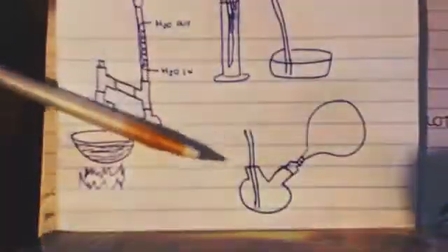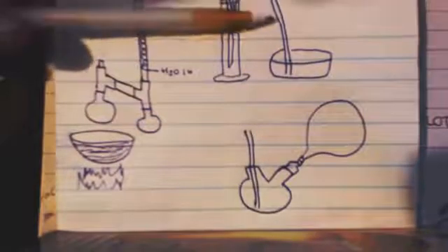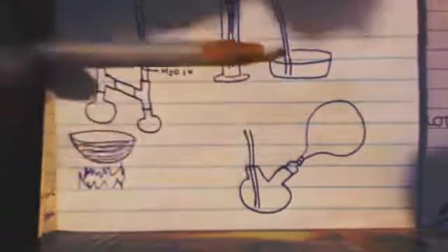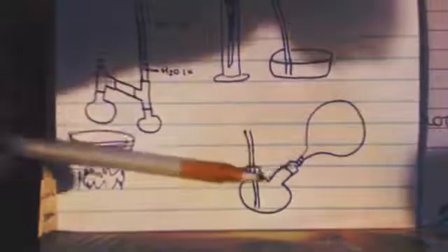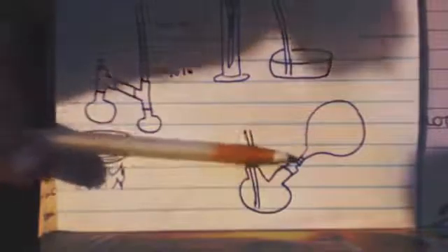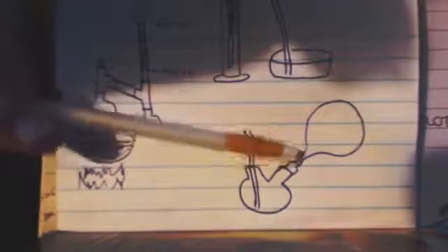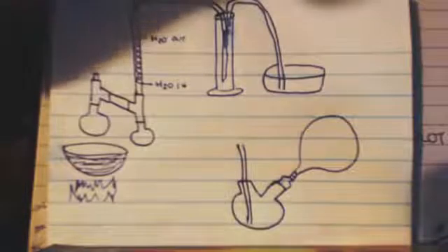Another thing you can do: pretend this is coming out and it went to your suck-back trap, now it's going into here. It's the same exact thing - you're bubbling it into your liquid. You could have a balloon on here with an attachment. This is a technique usually used for hydrogenation, but that's why I'm showing it.